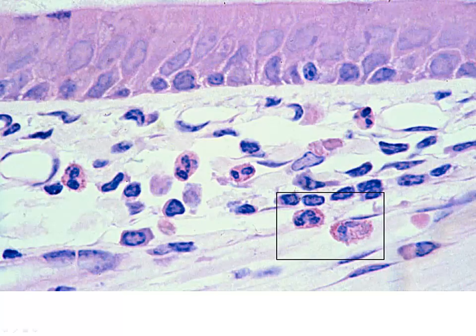Still working with respiratory epithelium. Lymphocytic tissue is also going to have a lot of our leukocytes. And these red granules, again, bilobed nuclei, all of these are our eosinophils. The color of the granules sometimes might be harder to see than others. And for me, if I can see the lobes of the nuclei with these different stained granules, that helps me know that we're looking at eosinophils. These are nice red, so that contrast really helps to bring that out.